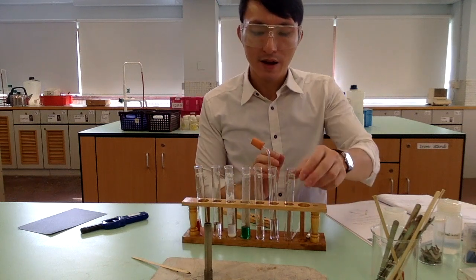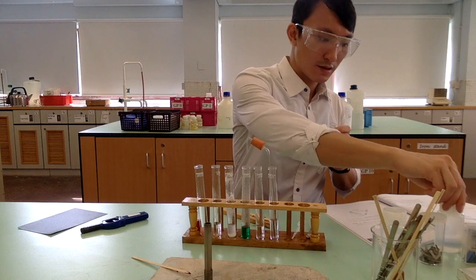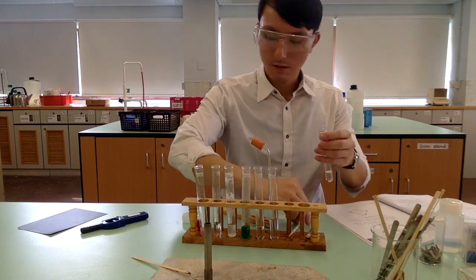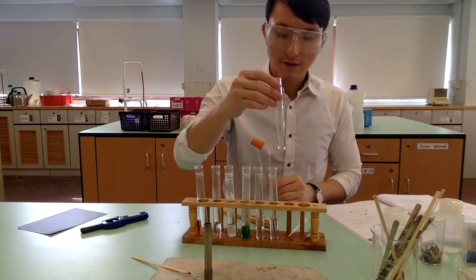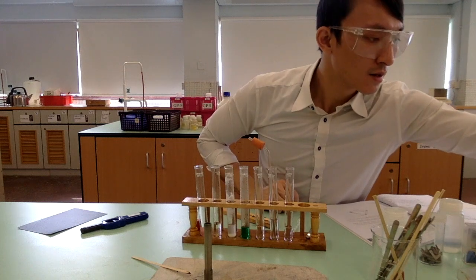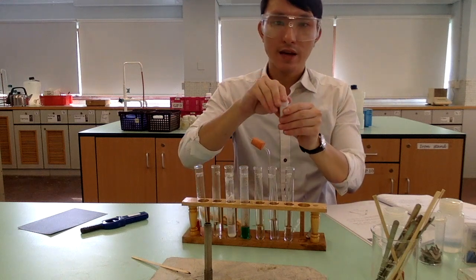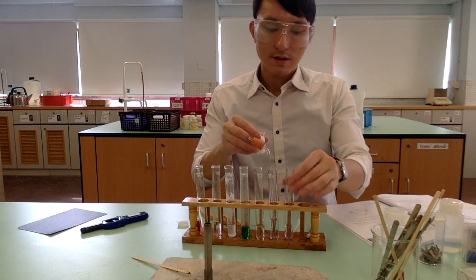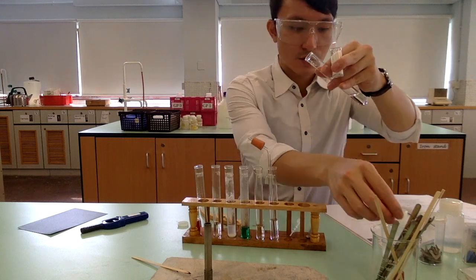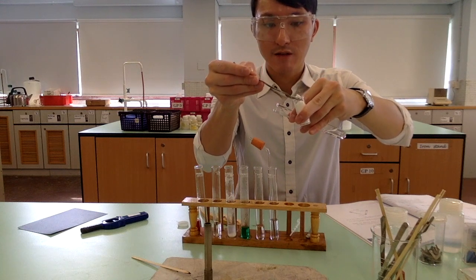Now, we need to prepare chemicals in another test tube. Here, we are going to add hydrochloric acid. Again, 2 measures of hydrochloric acid. And then, we are going to transfer some sodium carbonate. But this time, we are going to carefully transfer a small amount of carbonate onto the side of the test tube. So you need to be extra careful not to drop the sodium carbonate directly into the acid.